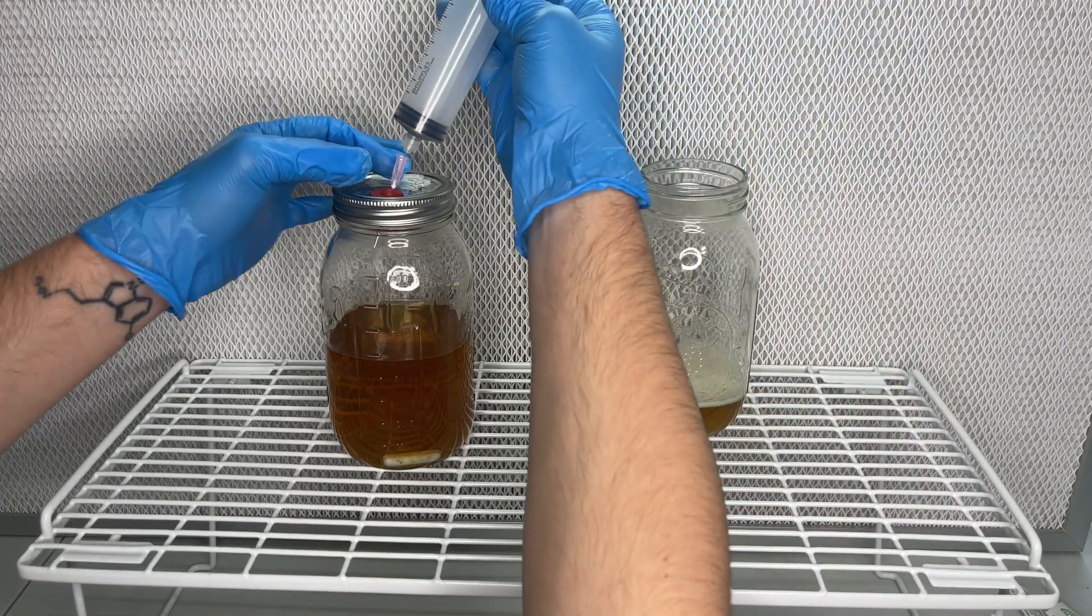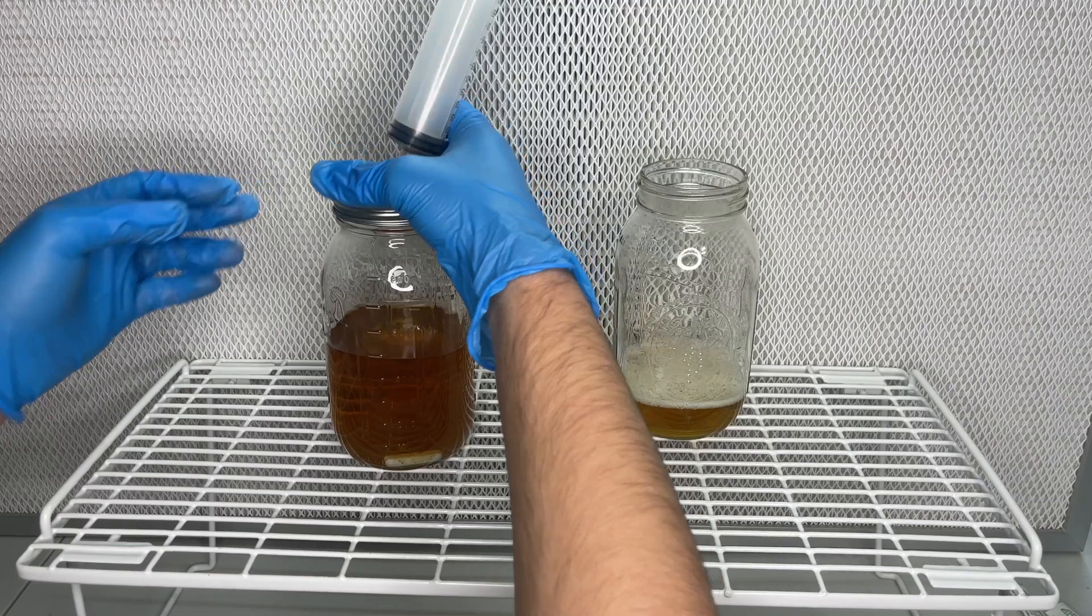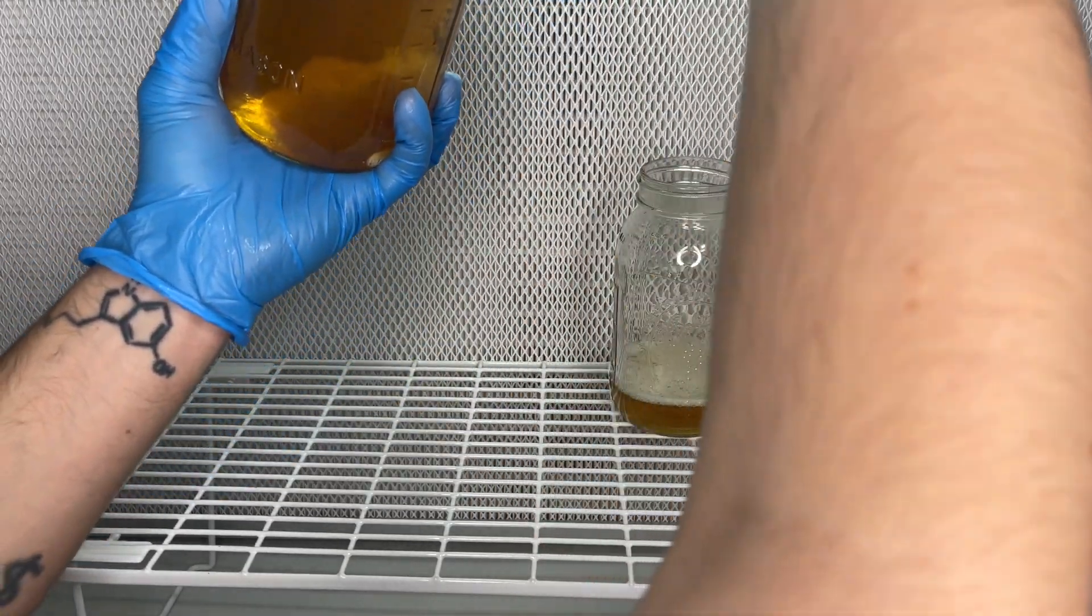I usually only do this with lion's mane because most other species, especially oyster mushrooms, will grow throughout the whole jar.